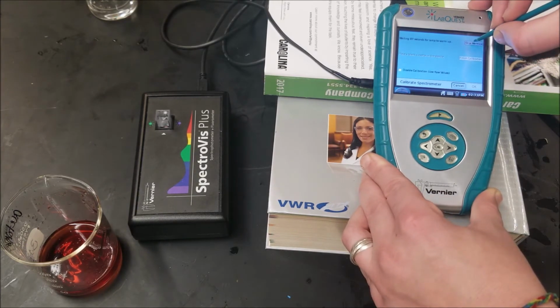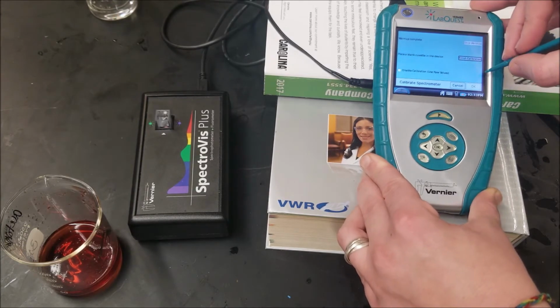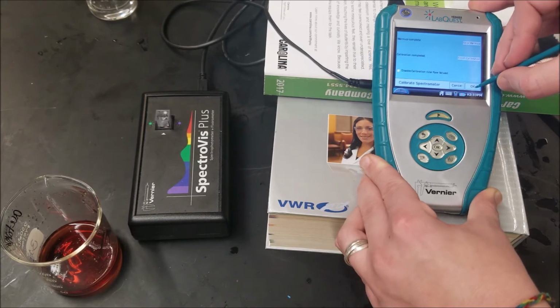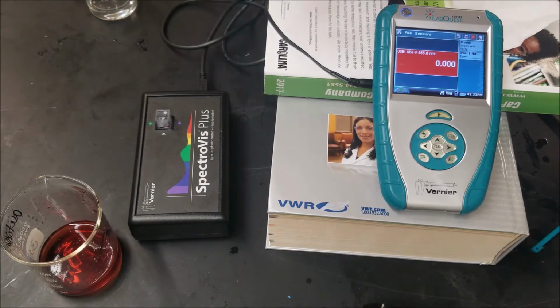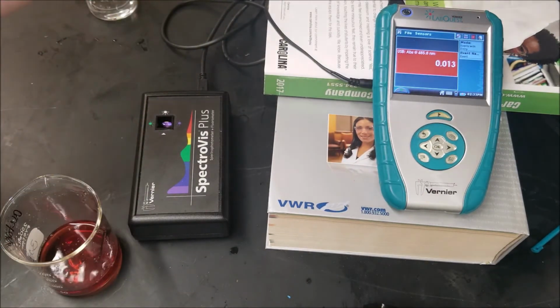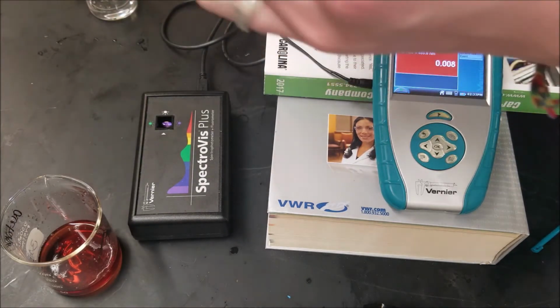I'm going to work from low concentration to high concentration so that when I dilute it, it's going to be less of an effect. Okay. Pour that into my waste. Coat the side with a little bit of my sample 1 again.